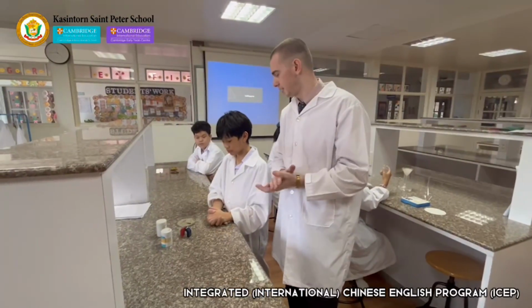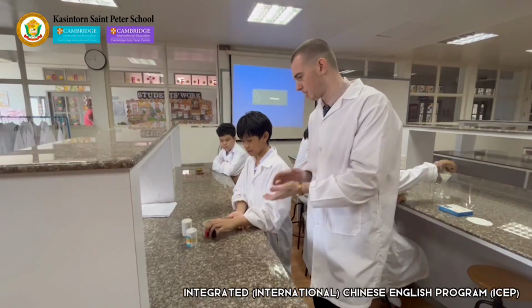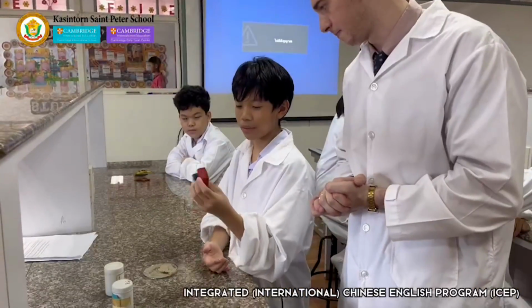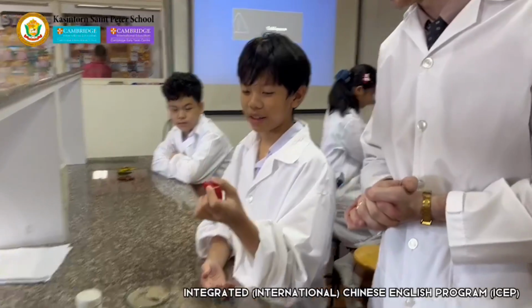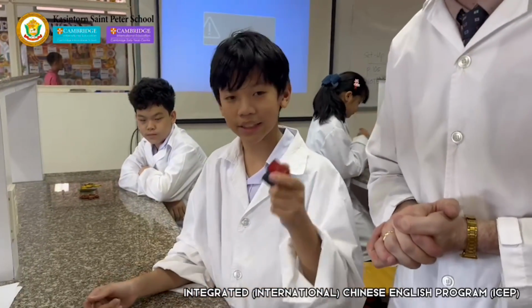Okay, and for our final experiment, we have Keen here. Keen, why don't you tell me what method of separation you are going to demonstrate today? This is my favorite. The magnet. The magnet is going to attract the iron filings. Let's see how it works.